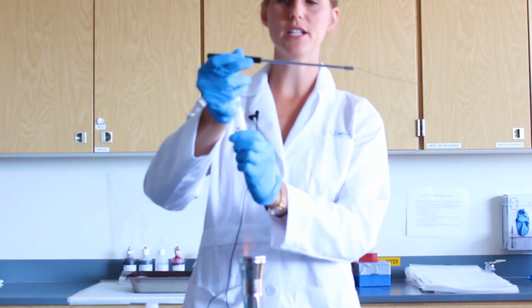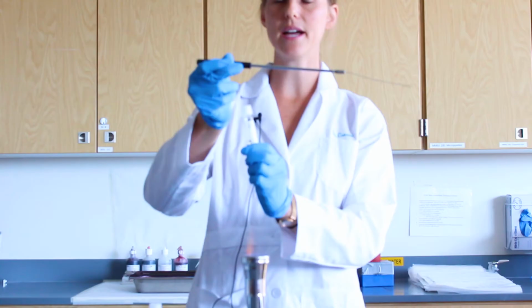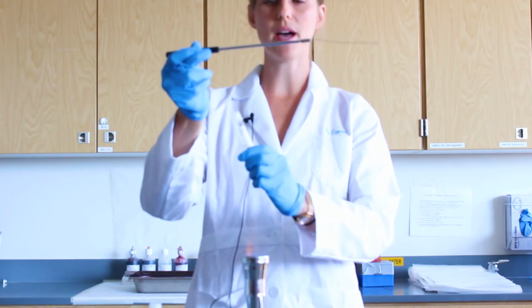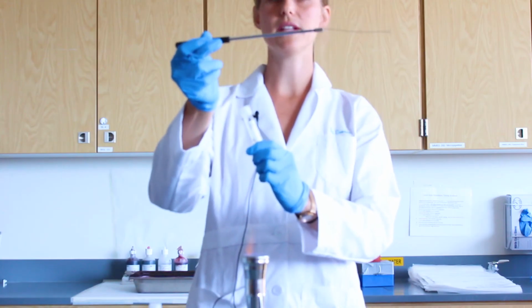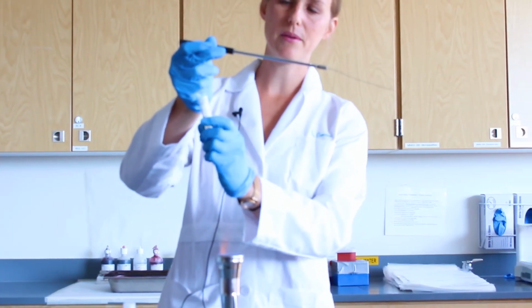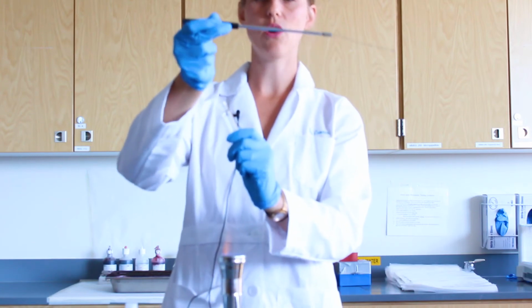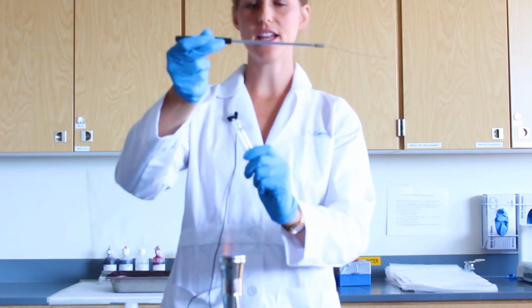This is very important because once you open the tube, you'll want to hold the cap facing down at all times. This will reduce the amount of dust and bacteria falling into the cap. You'll also want to hold your broth at an angle. This also reduces the amount of dust and bacteria that can fall into your broth. So again, I'm holding my loop like a pencil in my dominant hand, holding the broth in my non-dominant hand, and grabbing the cap with my pinky finger and opening it. Once it is open, always hold the cap face down and always hold the broth at an angle.